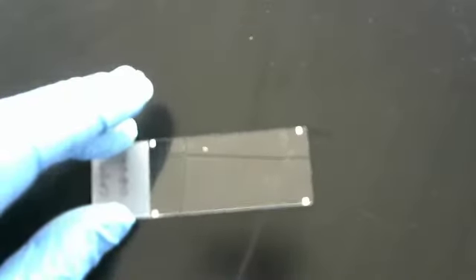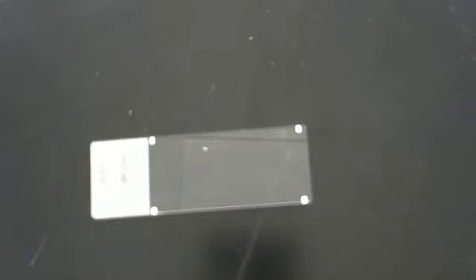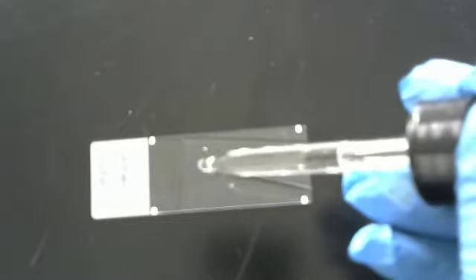Now, let's take a look at our control. We need hydrogen peroxide. Nothing happens, as is expected for our control.